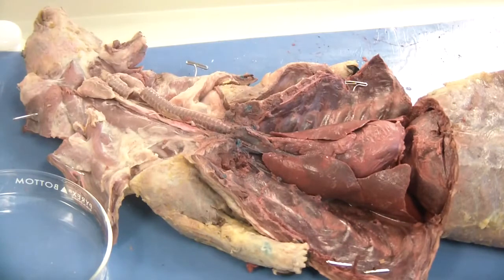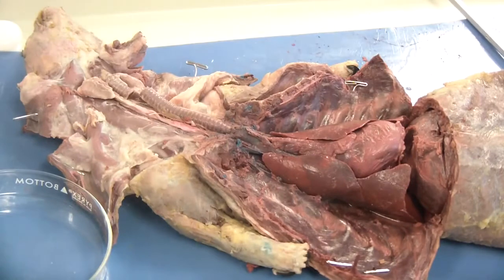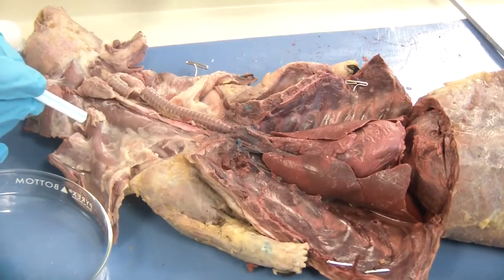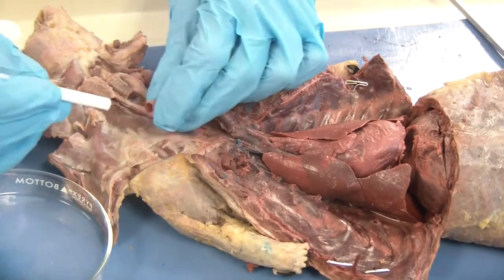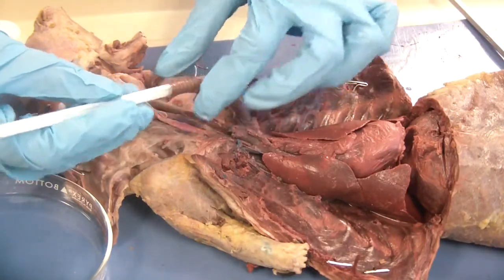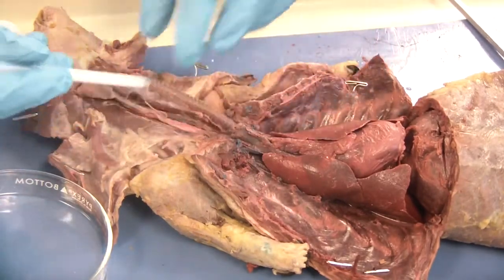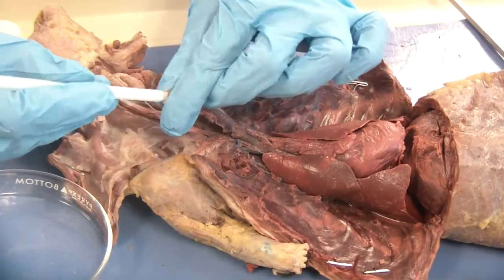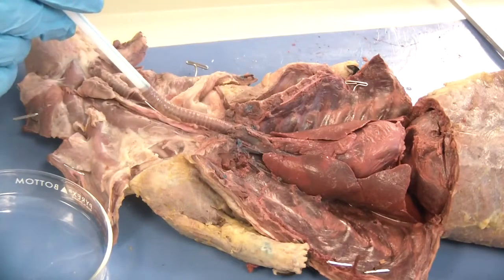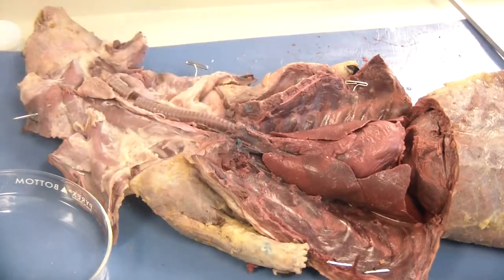One of the things it asks you to try is to insert a drinking straw, so we are going to try this. Get a clean drinking straw, and please do not touch the end that's going to touch your mouth with your mink gloves. You are going to place the trachea and the drinking straw together — in this case the trachea fits nicely inside the drinking straw, but if you had a larger mink, maybe vice versa. Fit them cleanly together and only blow into the drinking straw. Do not inhale because you might ingest some of that preservative solution and that would be bad.